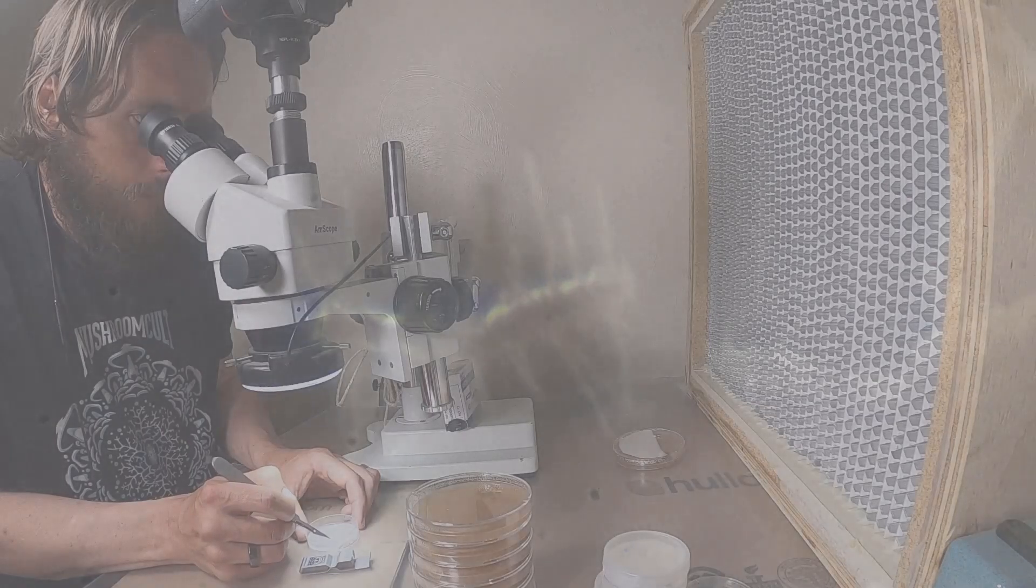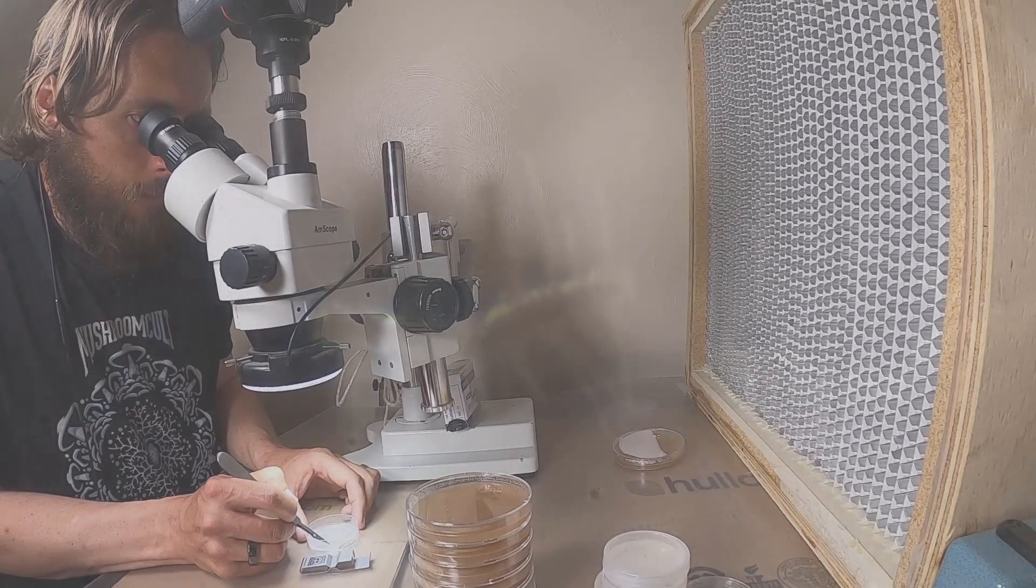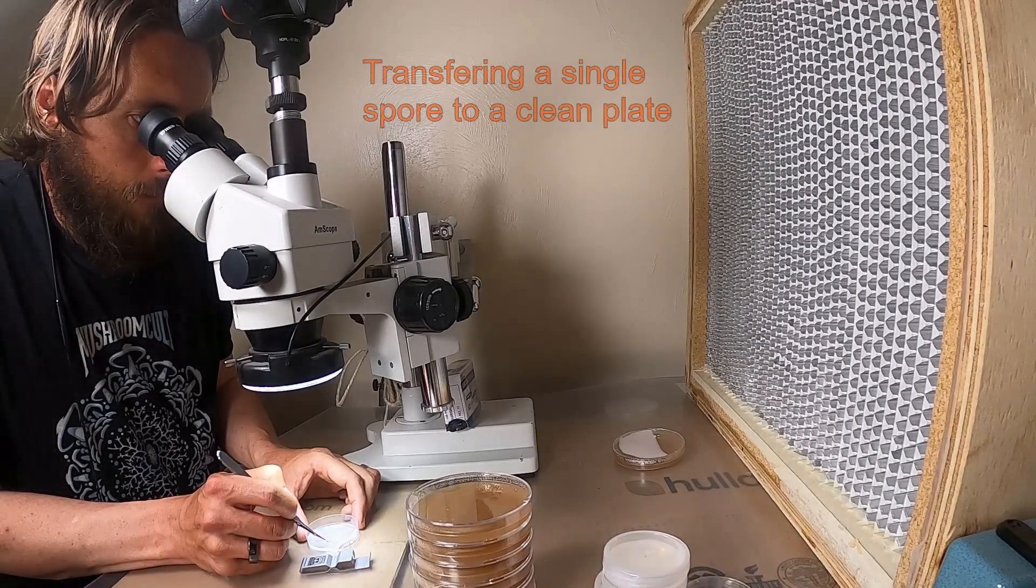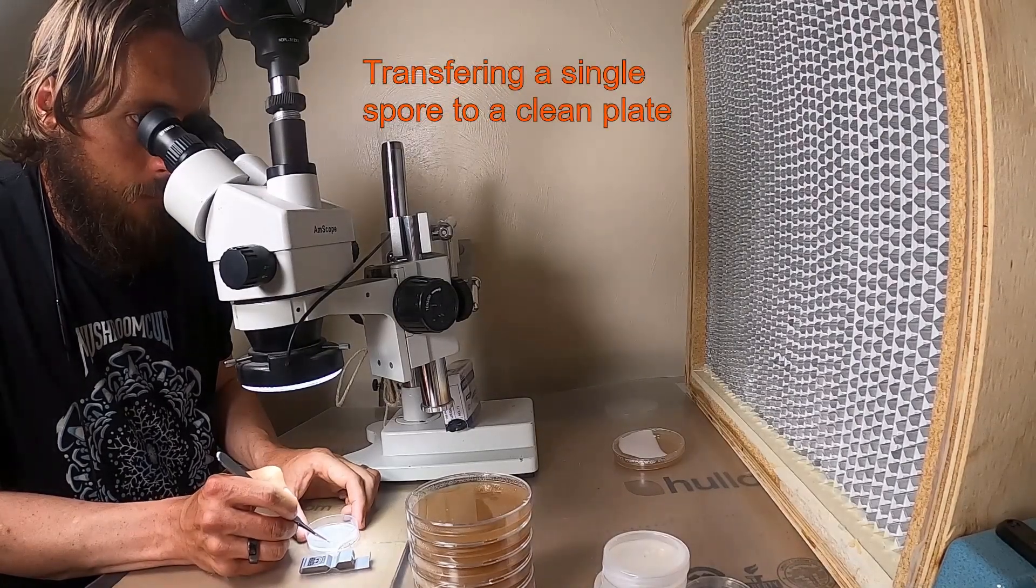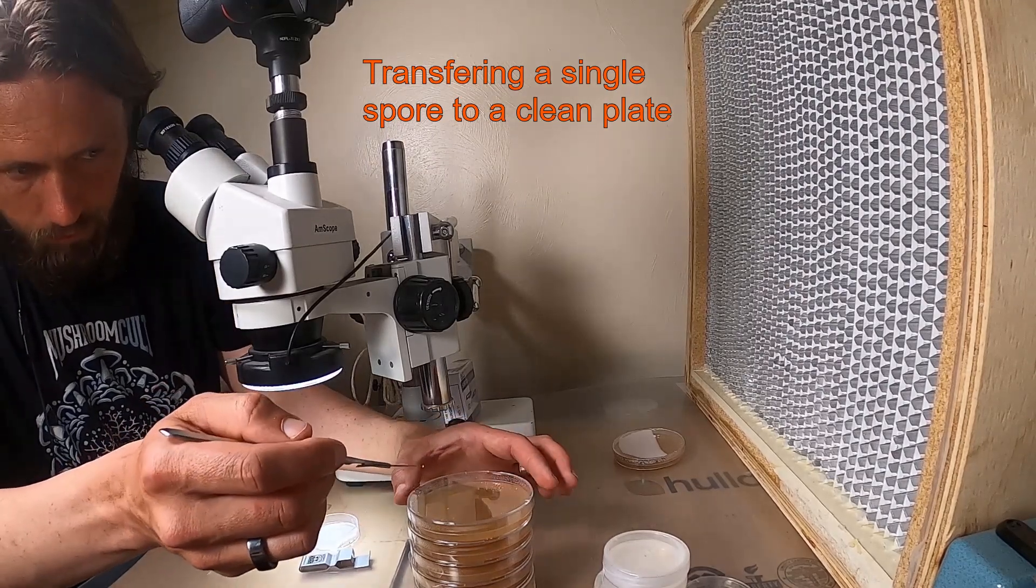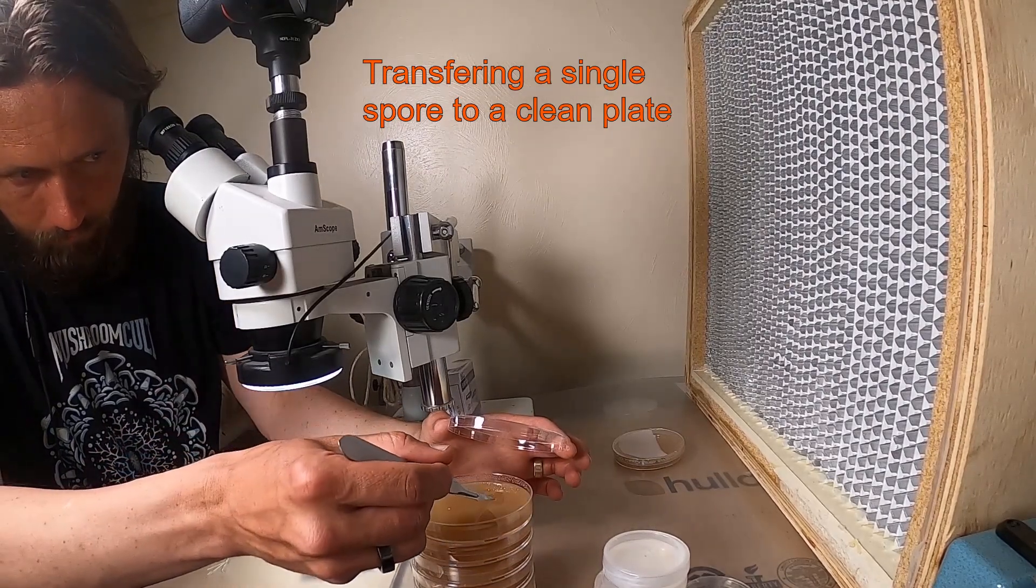It helps to use a stereo microscope but you can do it with the naked eye. You'll just have fewer options. I'm taking a sterile scalpel to remove a single spore and then put it on a clean nutrient plate.